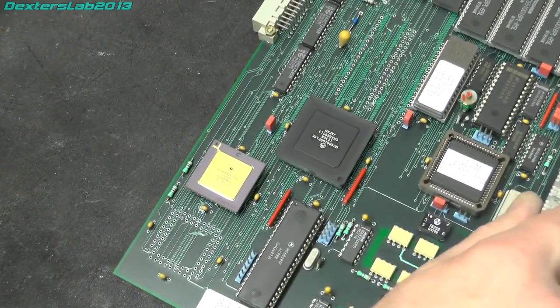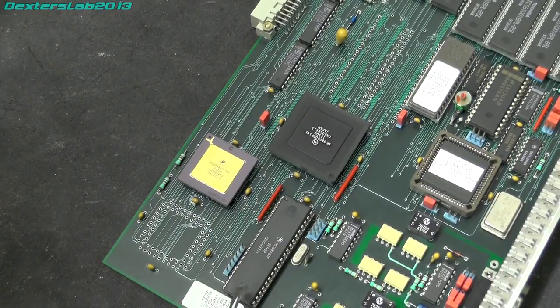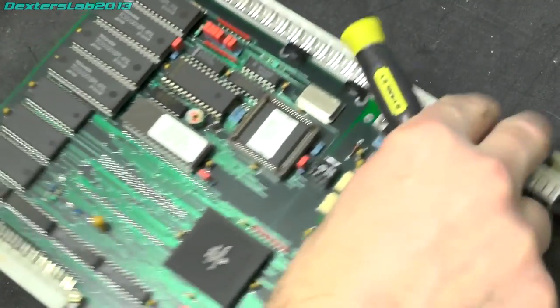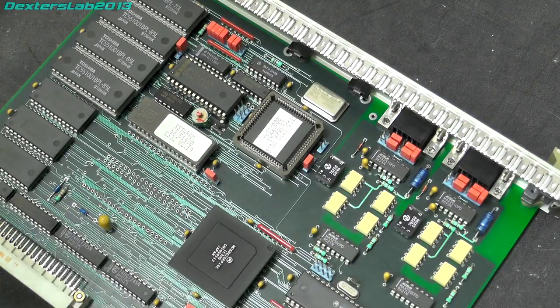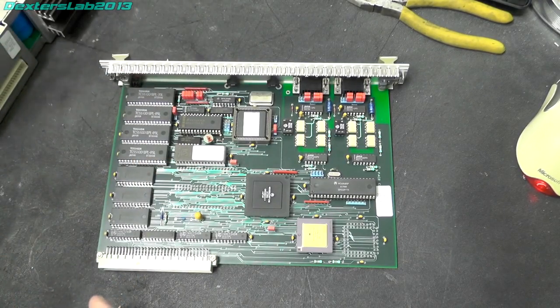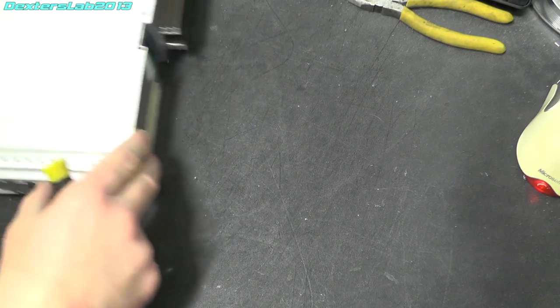But yeah, not sure. And next to that we've got an MC68681P. That will be a UART, which will run out to the two serial ports just here, obviously with opto isolation. Right, before we look at that EEPROM, let's have a look at this power supply box. I think it's possibly a bit more than just a power supply.